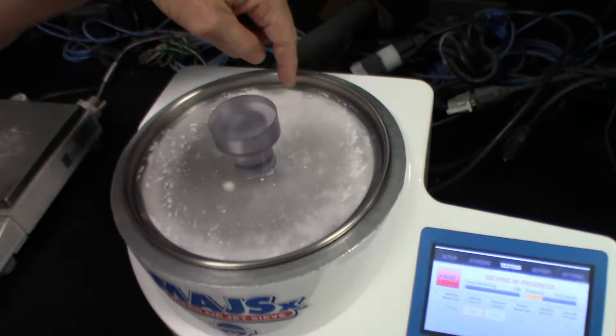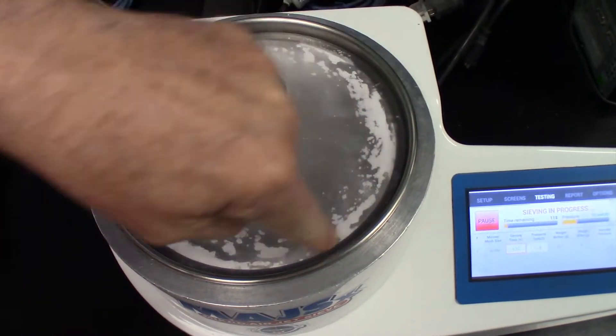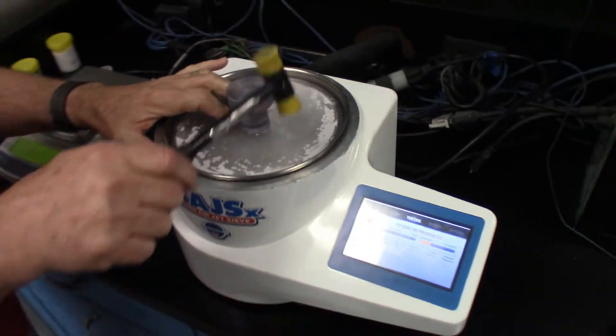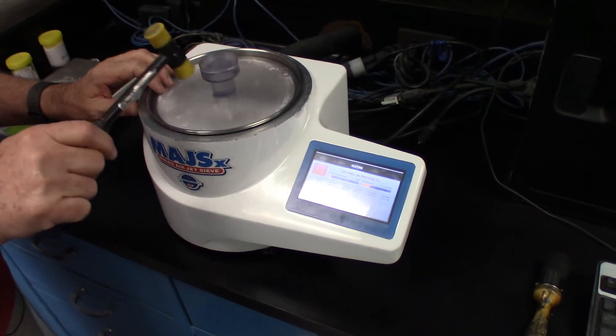As you can see, the material is being dispersed across the top of the screen. However, there is some of the ultrafines that are attached to the screen, so it might need a slight tapping.